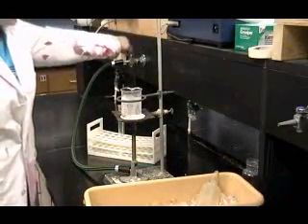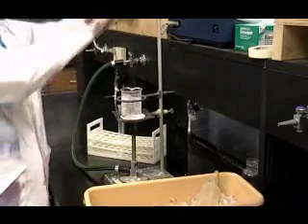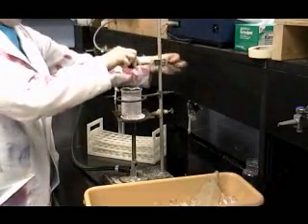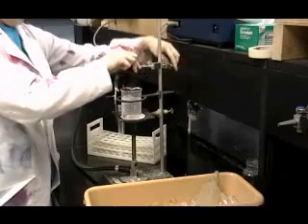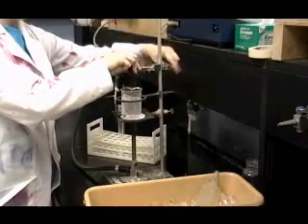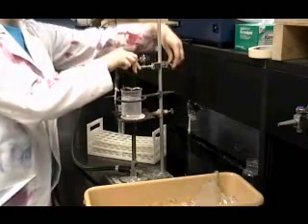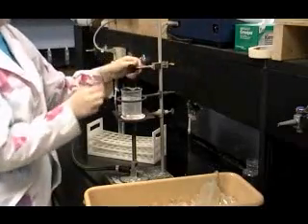When the water in the beaker begins to boil vigorously, begin step 3 by turning off the burner and clamp the test tube containing the salicylic acid with acetic anhydride and sulfuric acid into the hot water bath as shown in Figure 1.